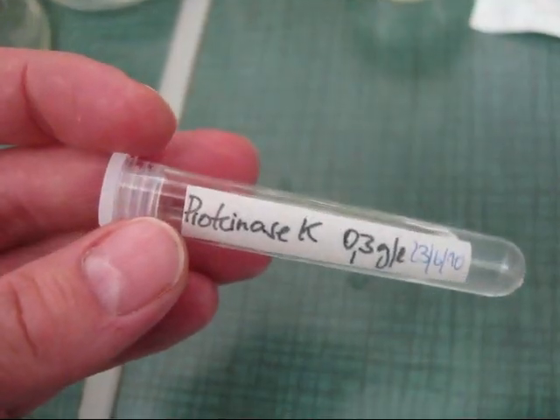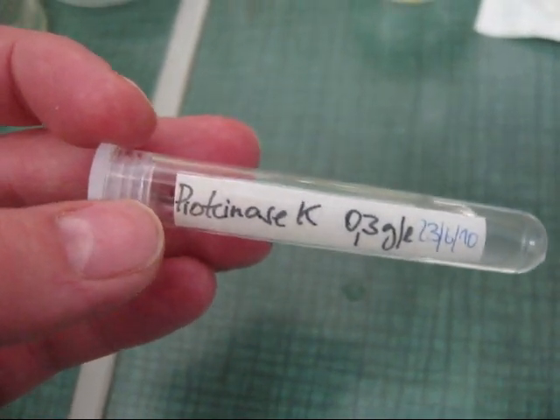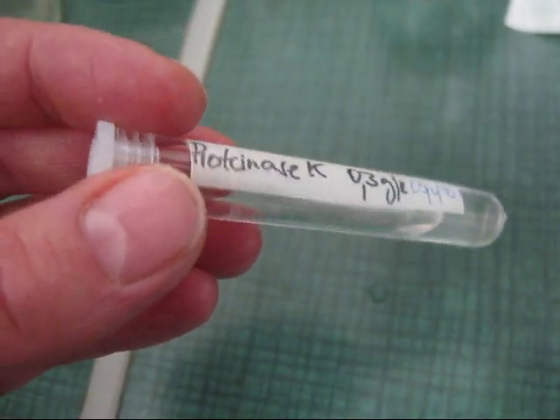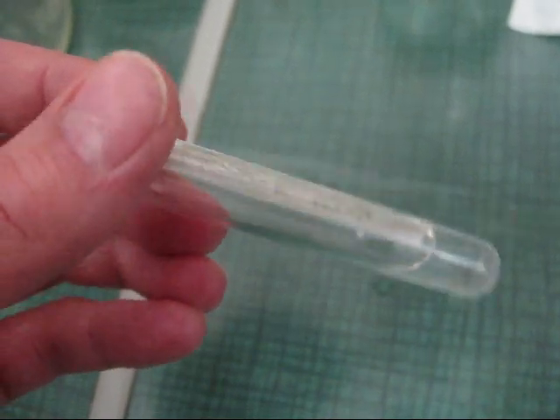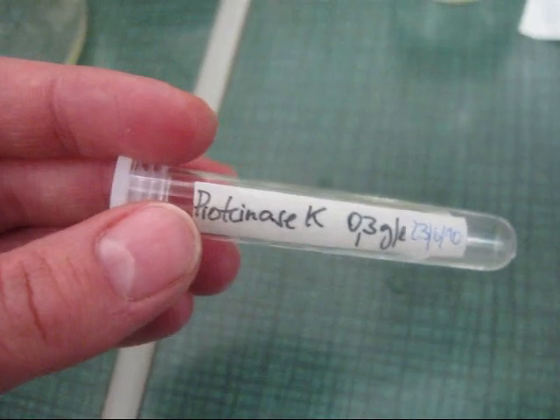Because this time I also have an enzyme called proteinase K. This enzyme will help to break up proteins and prevent their enrichment when extracting the DNA. So we will see how well that works.